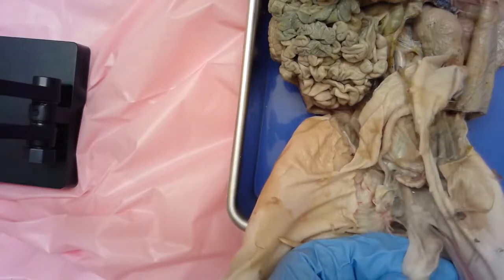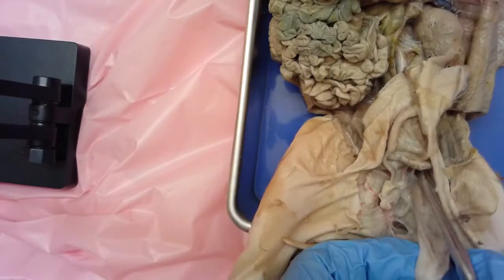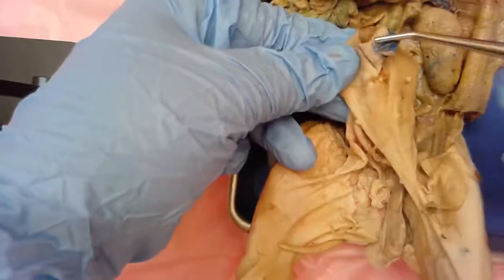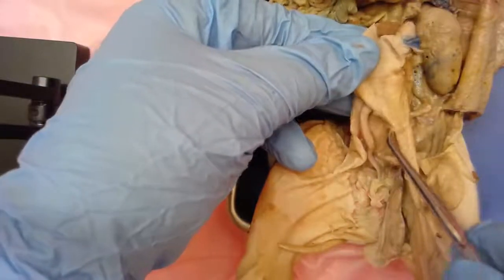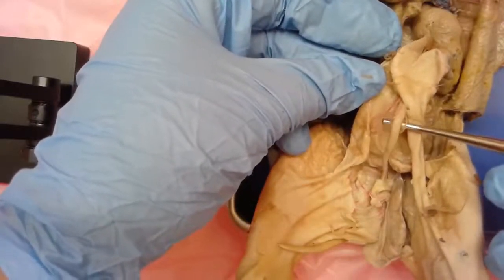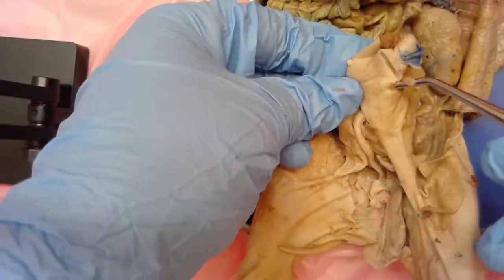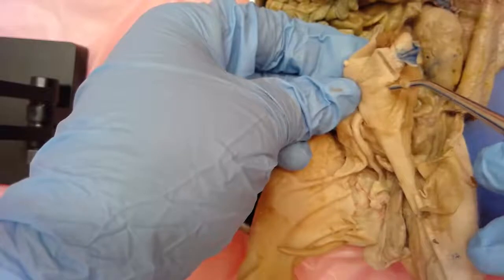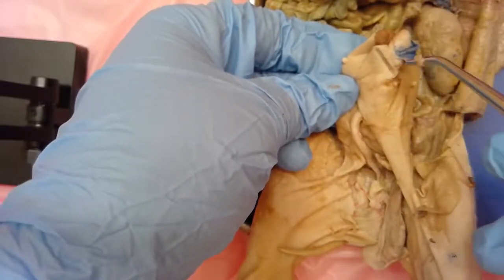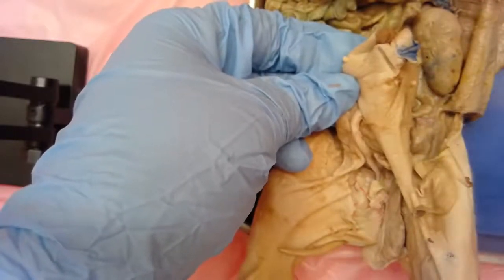You can see the epididymis in there, and it kind of goes all the way into the abdominal cavity. You can also see this little flap of skin where the umbilical cord was - I've cut into that skin and exposed this little tube here. This tube is actually the pig's penis, and there's that little urogenital opening that we talked about. That is where the structure exits during mating with a female.